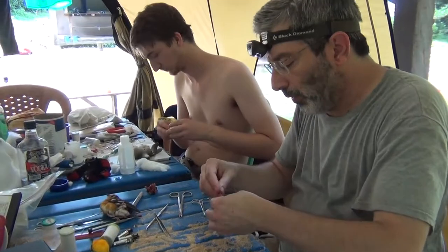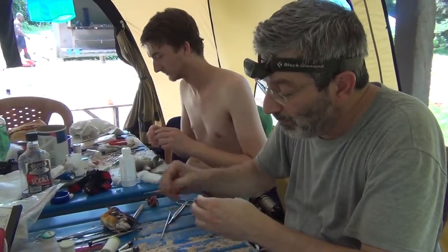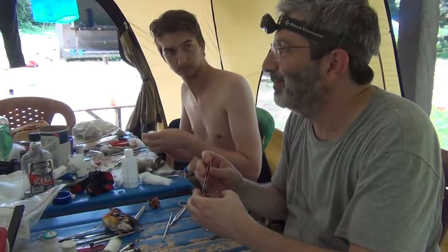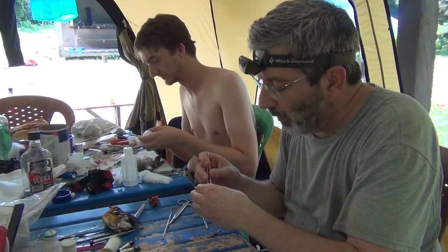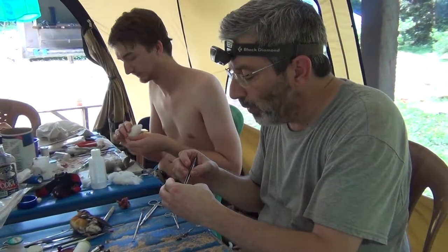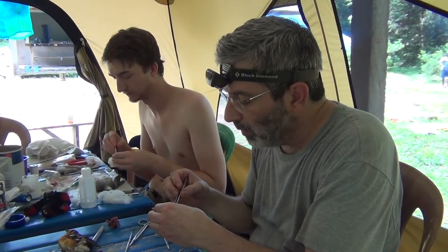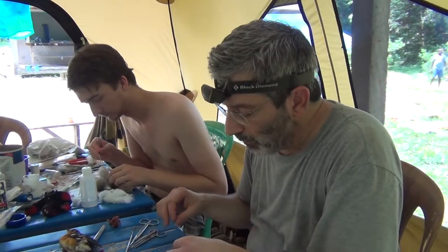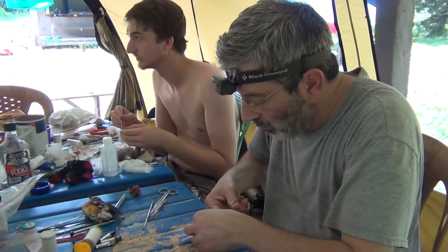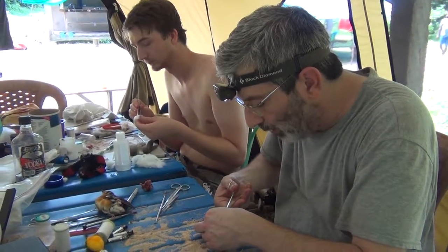And now the moment of truth — the bird is male or female. It is a female. The oviduct is actually convoluted, so this bird is perhaps getting ready for breeding activity. The largest follicle is two and a half or three millimeters, but not yellow yet. The stomach just has vegetal matter but nothing recognizable.